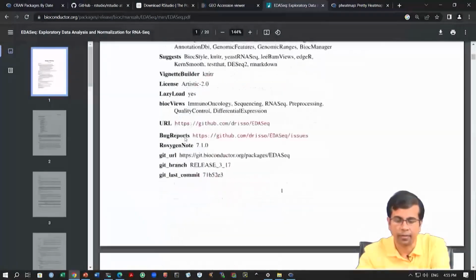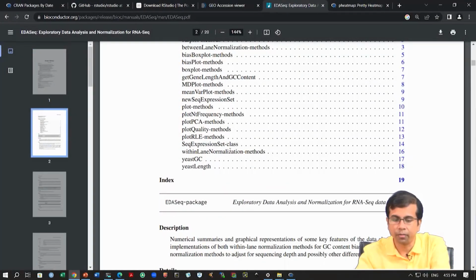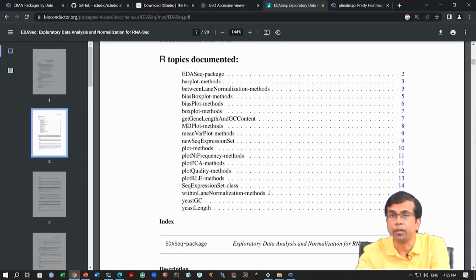Okay, so one of the things we need to do is this within-lane normalization. This is the function that we will use for our bias correction part, and you can see again we need to create a specific data format called an expression set. I mentioned that for many packages you will see they require a specific data format to be created from the count data or matrix data that we are working with.